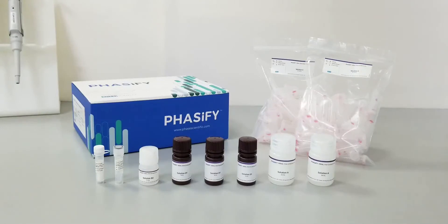This kit should include six types of reagents, two of which can be found in a smaller cold box.